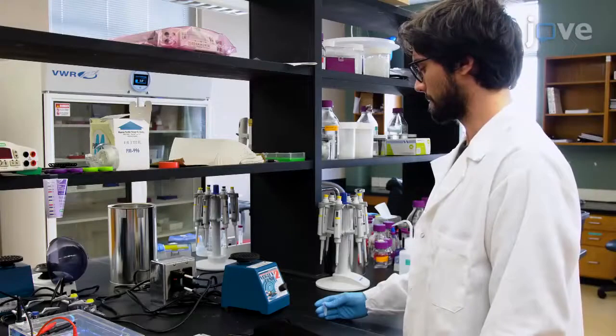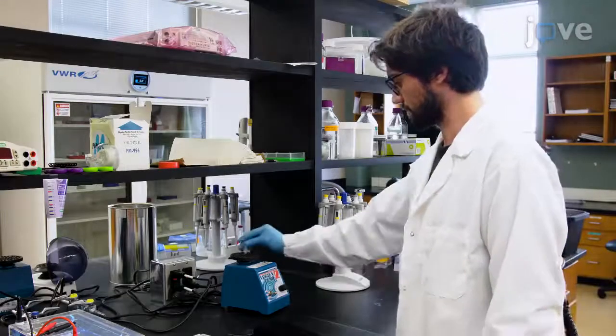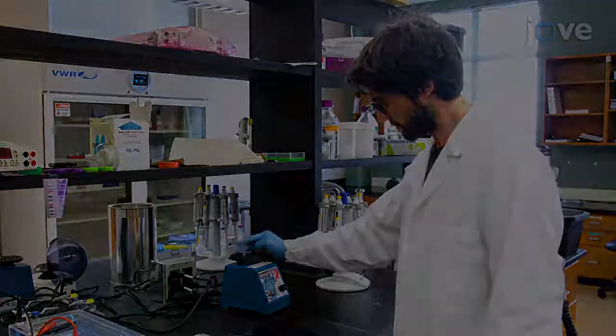On the next day, prepare DNA extraction buffer as described in the manuscript and mix well by vortexing.